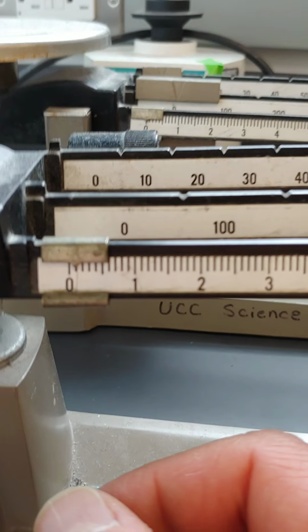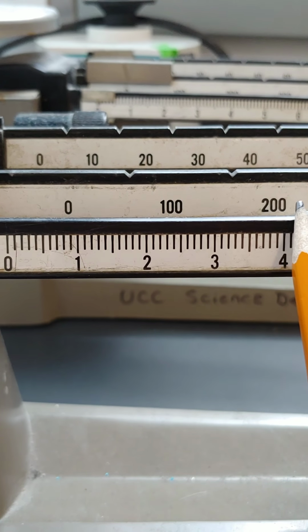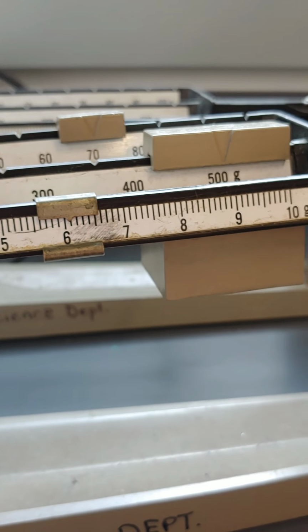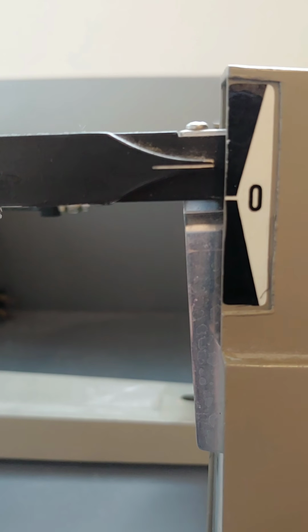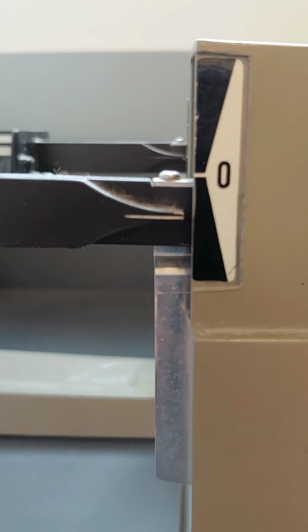And then we take this last little bar here in the front, which is the ones place, and we move that until we get our little line. We knew it was somewhere between 570 and 580, and we're still above, so we're going to go to 5. We're going to move that to 6. Now let's try 7. Let's try 8. Oh, yeah, we're getting some possible movement there. Not quite yet, but we're getting close. We'll move that just a little bit at a time.